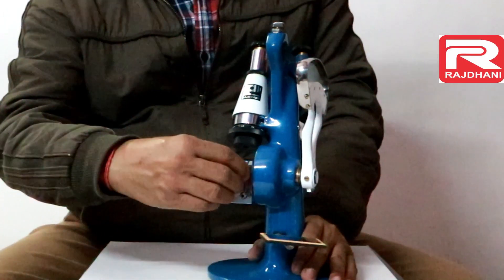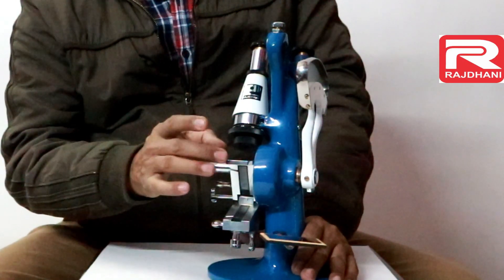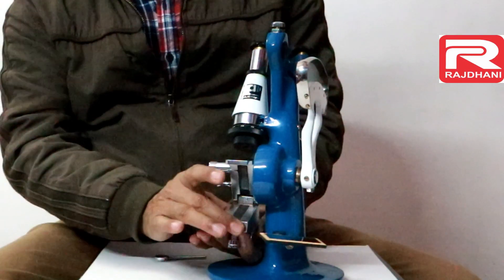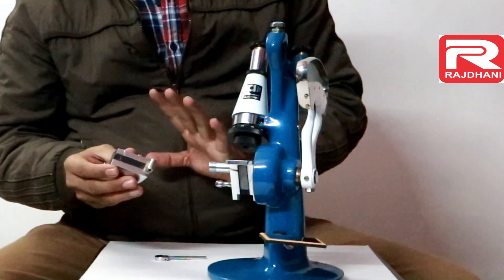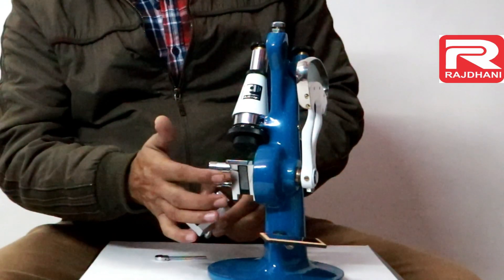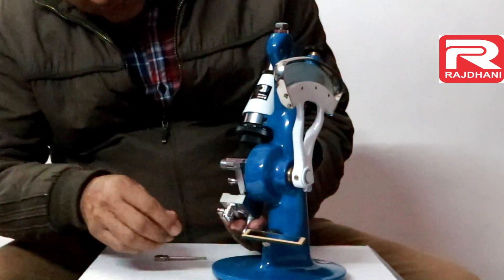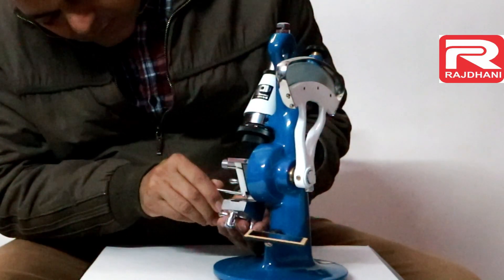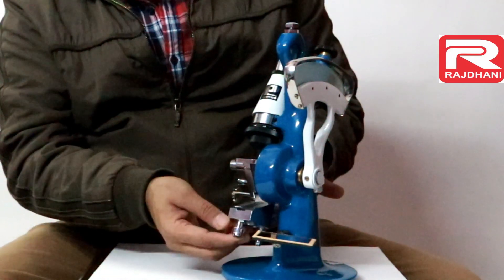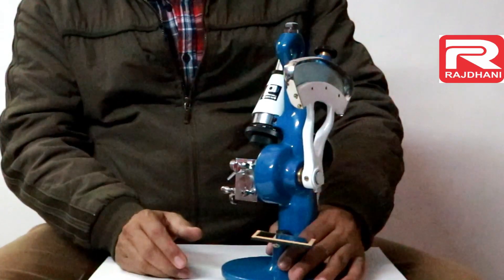The main part of the instrument is this prism box. It is in two parts — an upper part and a lower part. The lower part is movable and the upper part is fixed. It can also be detached by pulling out this locking pin. The upper part is more important because the main prism is here, and this is the subordinate prism. You can see this lower part move up and down, and this lock pin locks both the prism parts together.